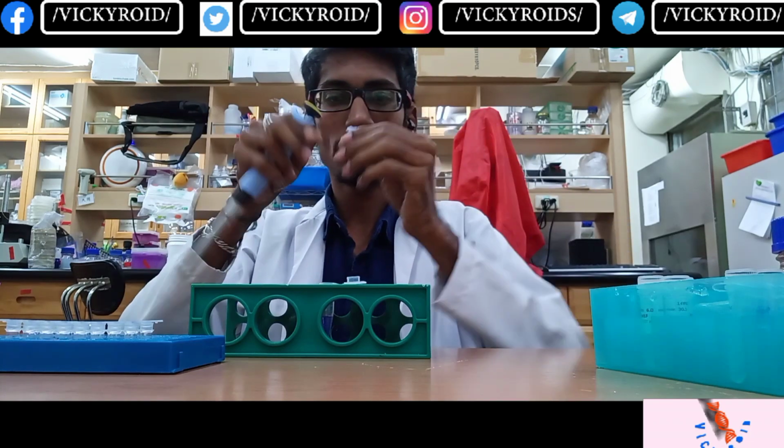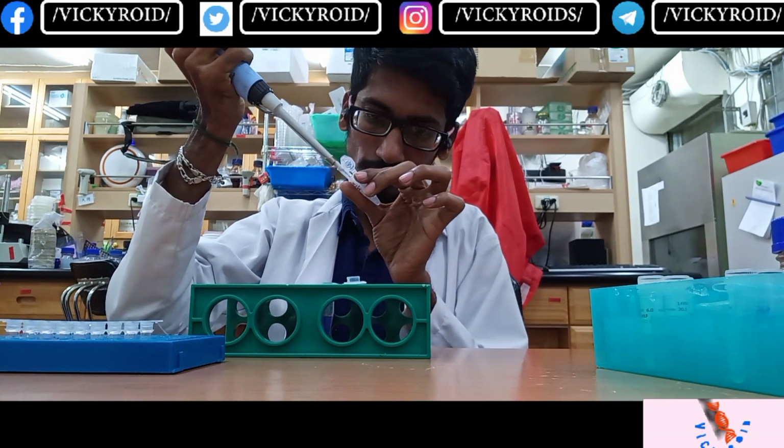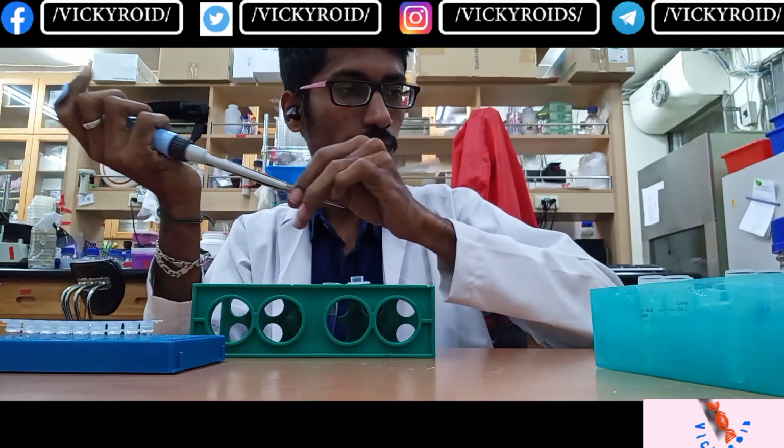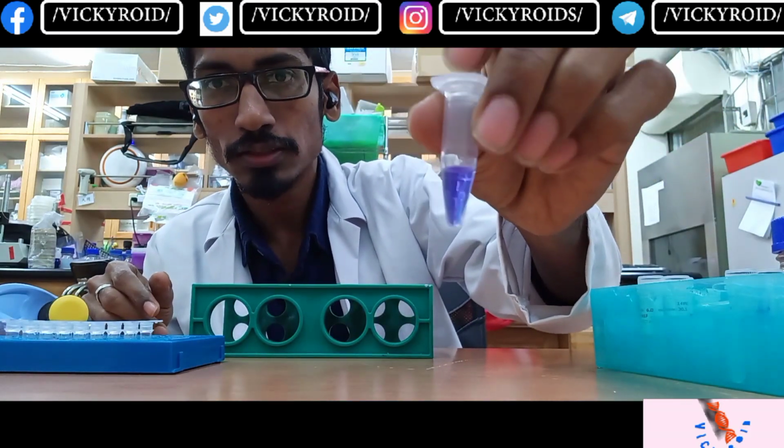So here it is, the M13. Now it has the master mix, the water and the primer.